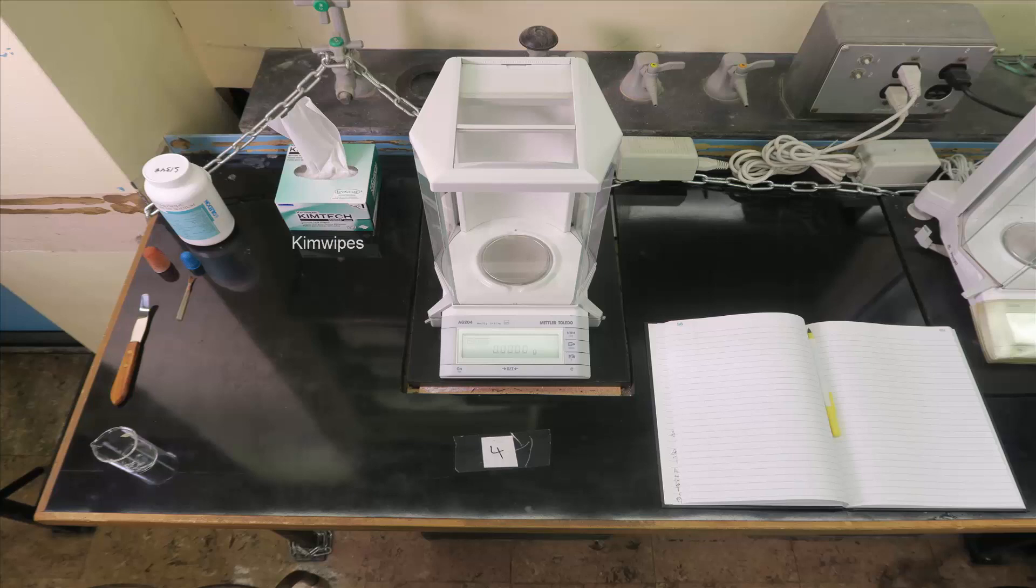To weigh by difference you will need kim wipes, finger cots, camel hair brush, a spatula, a beaker, a laboratory notebook, and a sample or compound in a container to be weighed.